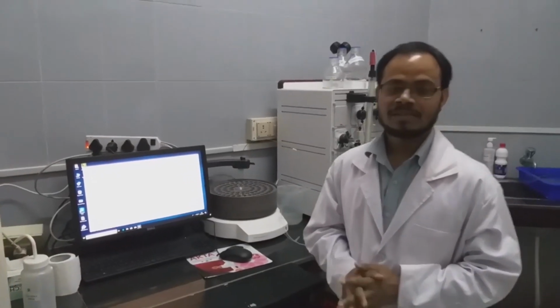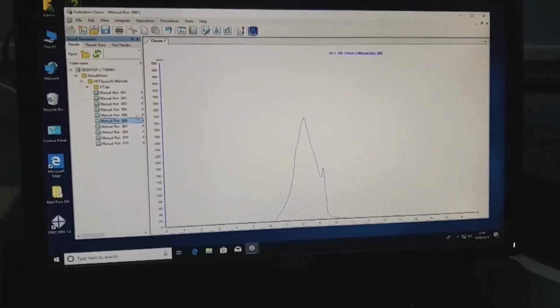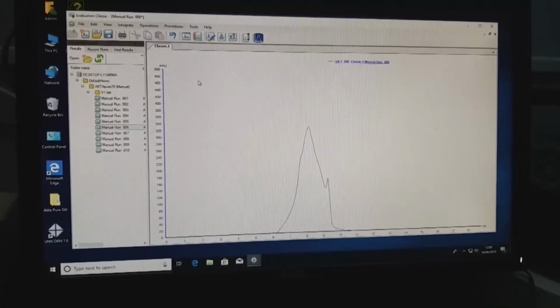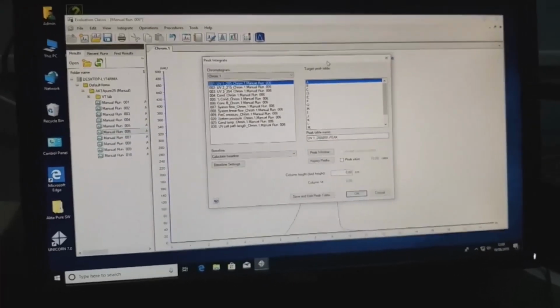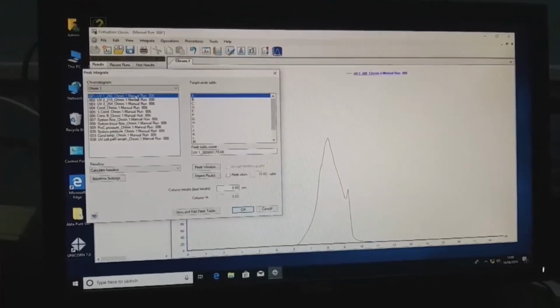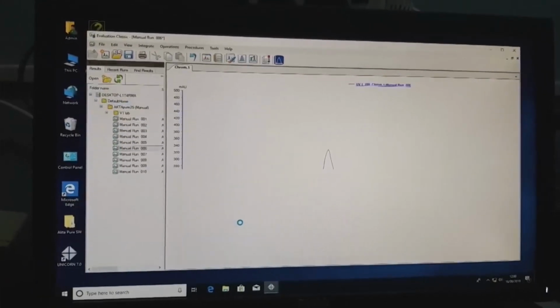So once the gel filtration run is over, we have to analyze the results. This is the software we will use for the evaluation purpose. So we have to open the chromatogram which you want to analyze. We already opened it. This is the chromatogram we ran recently. So we have to analyze peaks. The peak integrate option is there. Just say which one you want to analyze, UV 280 nanometer or 215. We have only 280, so let's say analyze.